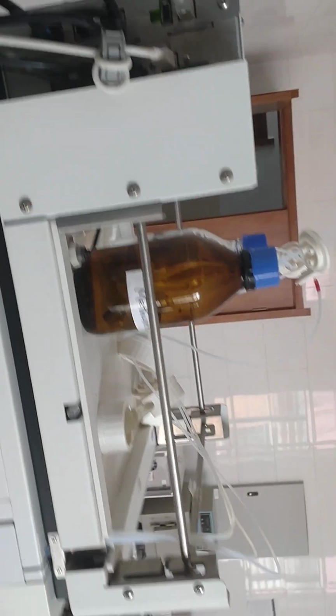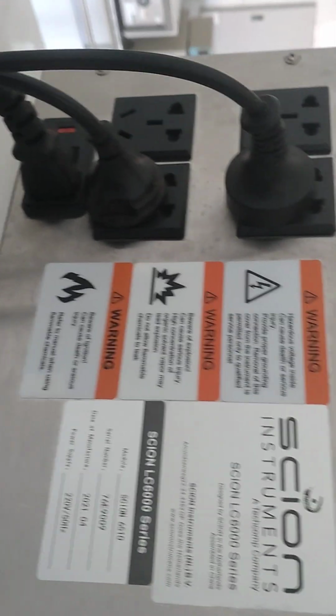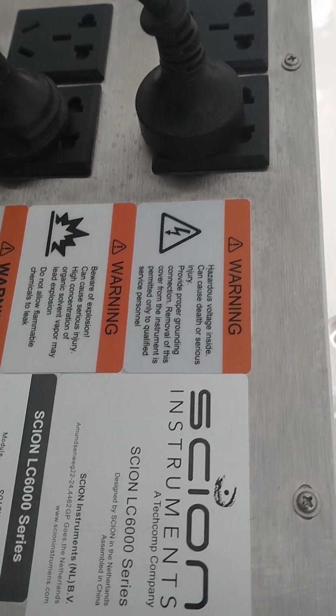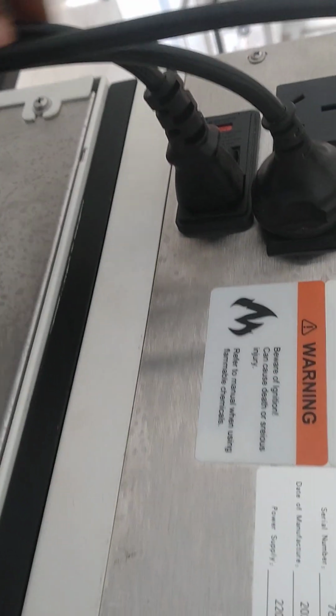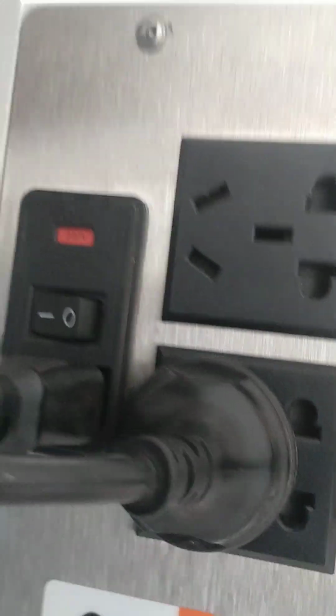Maybe I can also show the connection of the cables. So right from this top, we have some cables of the detectors and the pump, but this is the cable for the organizer. This is the one, and we have to turn it on by pressing this button.